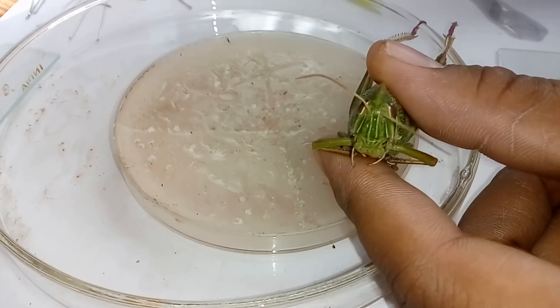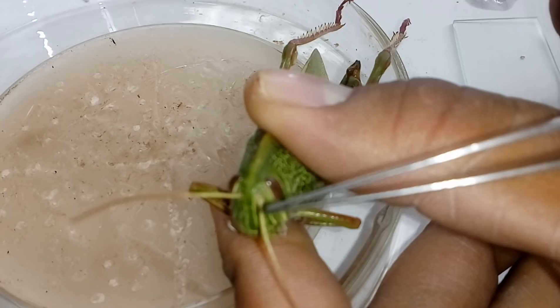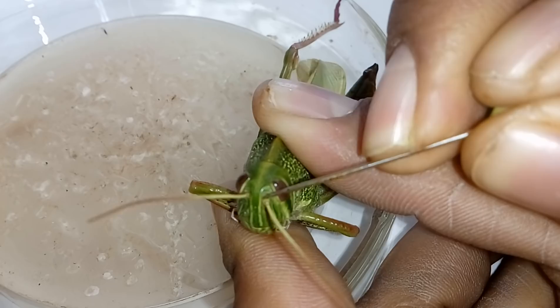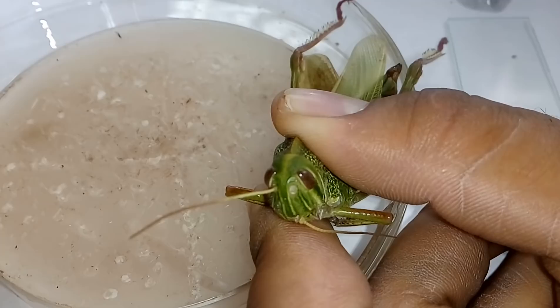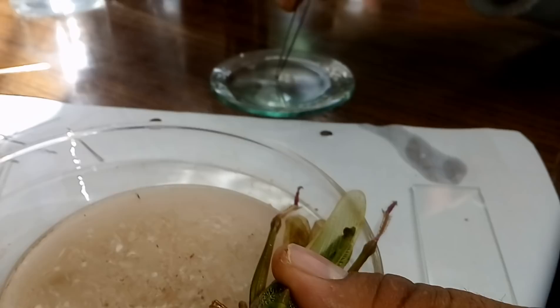First we have to remove the antennae of the locust. The antennae segments are: this is the flagellum, then it is the pedicel, then the last slightly broad one — this is the scape. To remove the scape, using your pin, slightly just cut it very carefully. Your whole antennae segment is now removed. Put this segment into 70% alcohol, as this is very necessary for the preparation of slides.